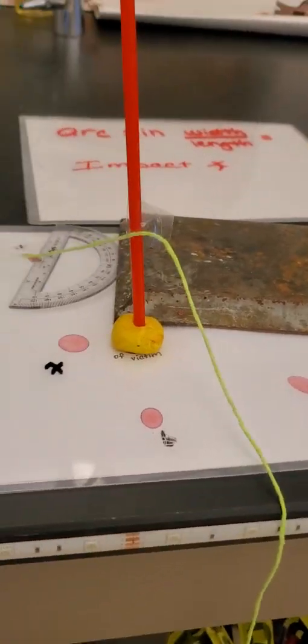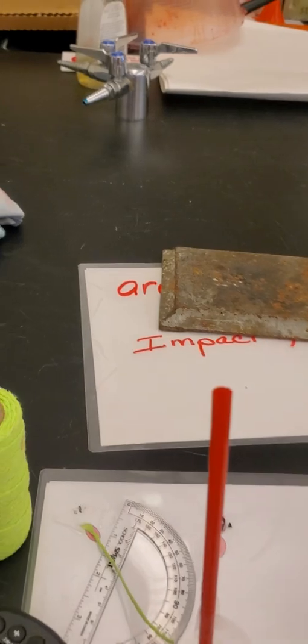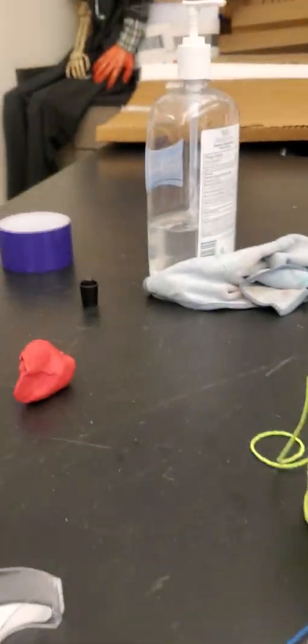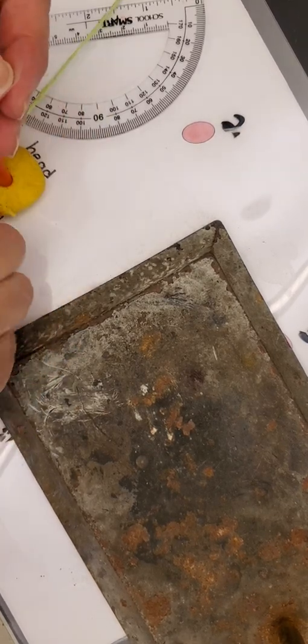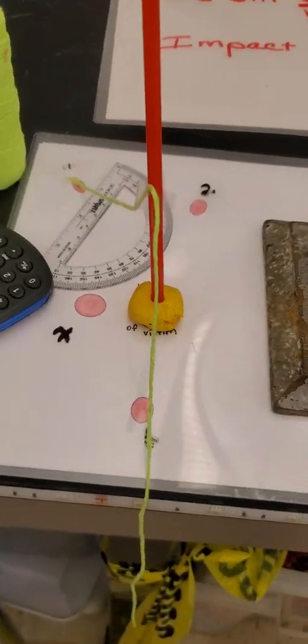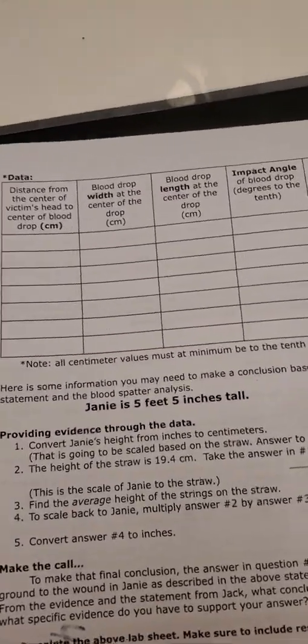You're going to do that for all seven of the blood spatters. Also, using your ruler, measure how high each string hits on the straw in centimeters — you want the height in centimeters for each string. When you have a partner it's much easier. Once all seven strings are attached to the straw, fill out the data table.